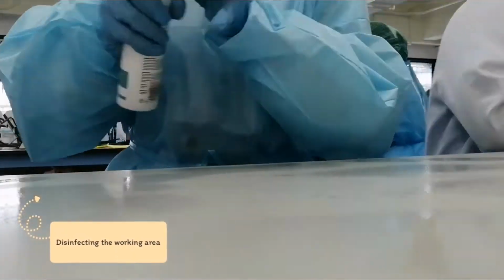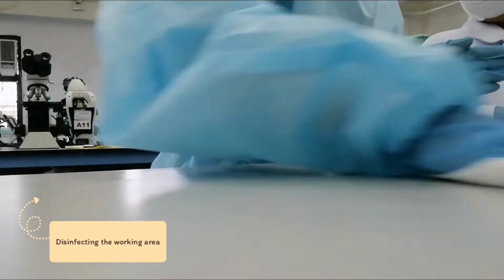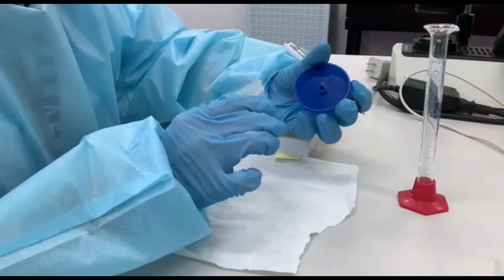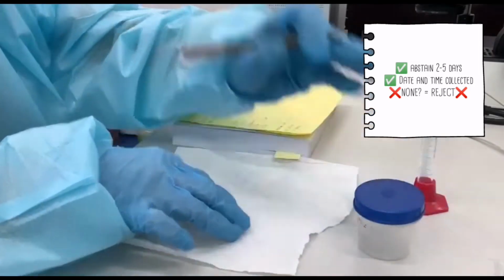The first thing you should do after donning is to disinfect the working area. It is important to note that male patients for semen analysis should abstain 2 to 5 days prior to testing.